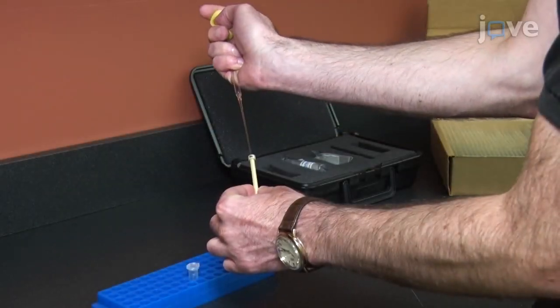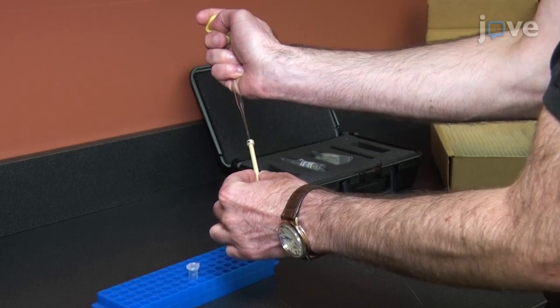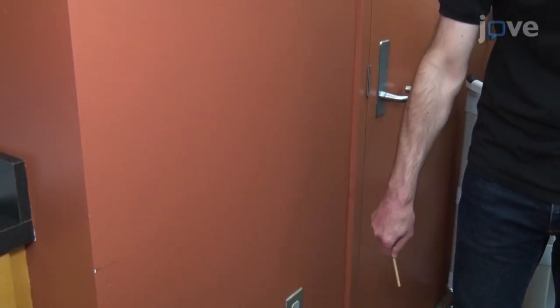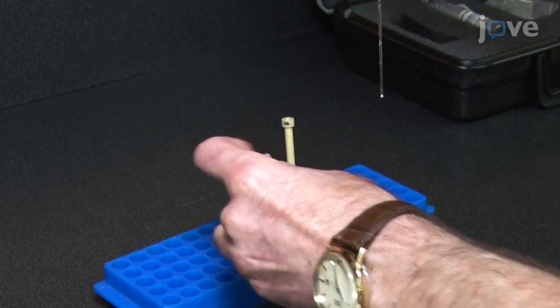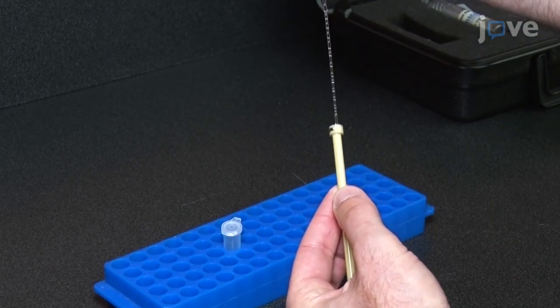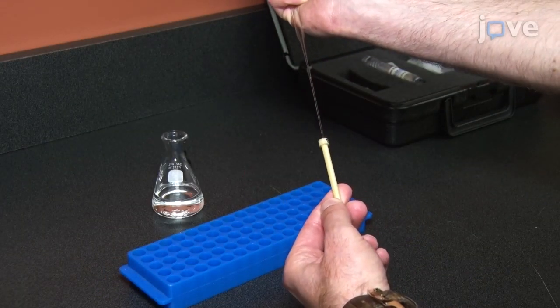To begin, introduce the nitrogen-15 labeled sample into the zirconia tube using a glass pipette, and ensure the sample seats at the bottom of the tube. To prevent the sample from mixing with the transmission liquid, overlay the sample with 200 microliters of mineral oil, and then fill the rest of the tube with transmission liquid.